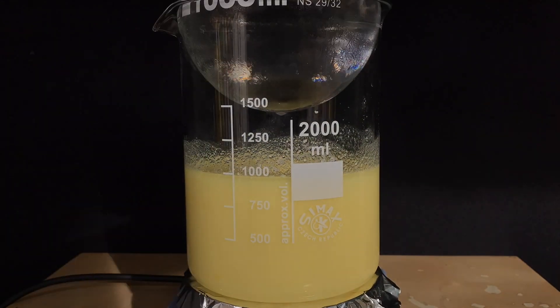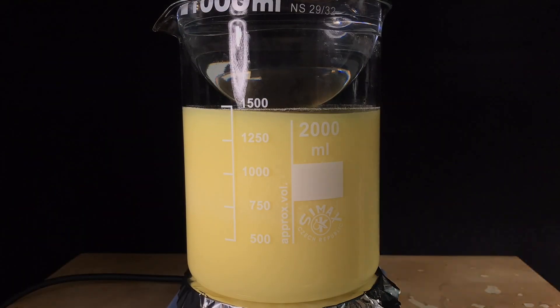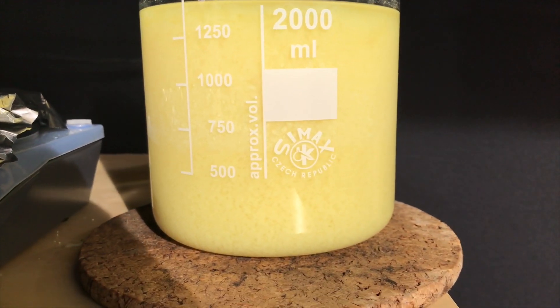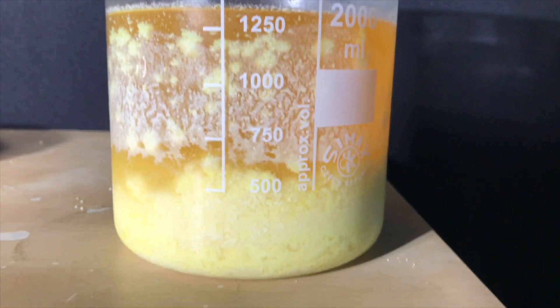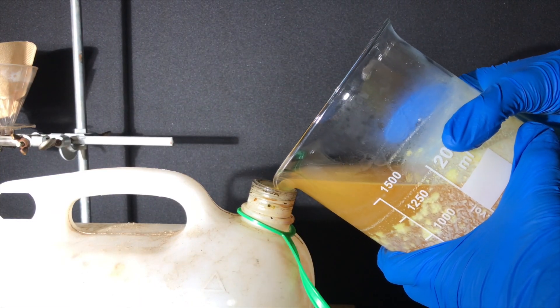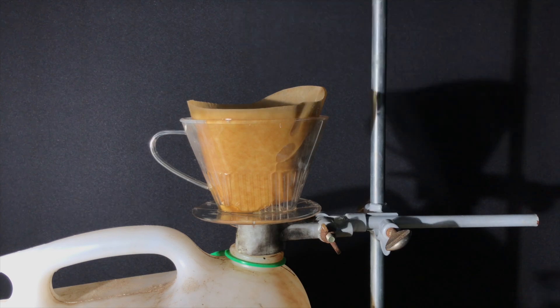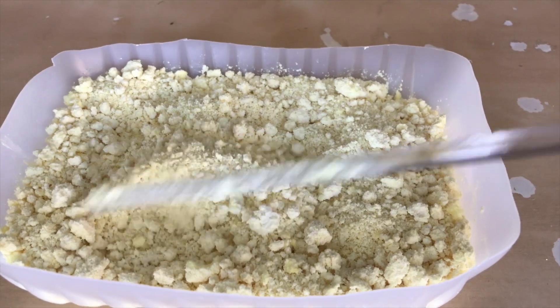The ethanol was brought to a boil, even more ethanol was added, and I even put a flask full of water on top of the beaker to limit evaporation. I can't quite call what we are doing a proper recrystallization — a true recrystallization would be if I used so much solvent that everything dissolved, followed by letting the product crash out. After cooling back down, the product still looked much cleaner because a lot of contaminants had dissolved into the ethanol. Most of the ethanol was decanted off and then we did a gravity filtration.